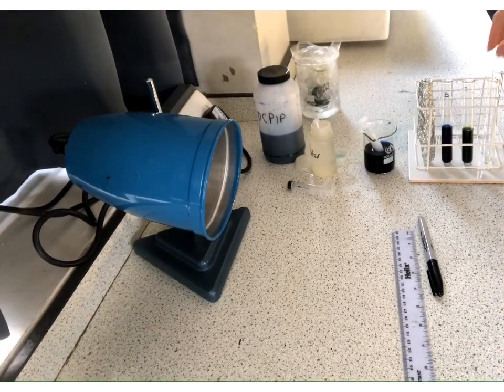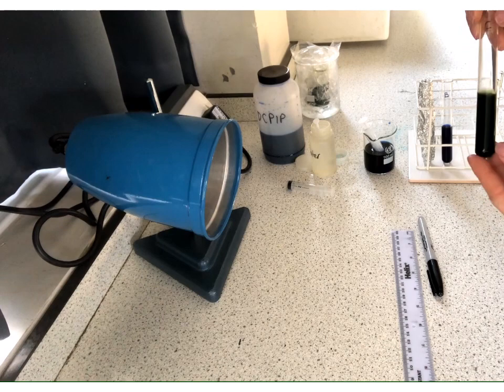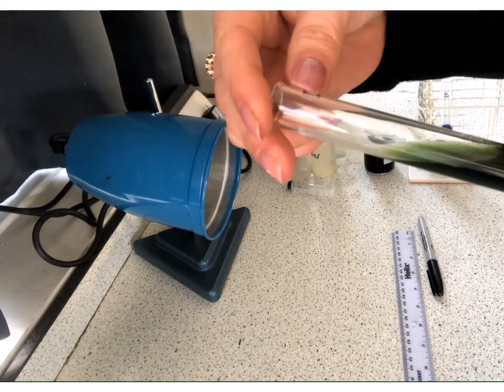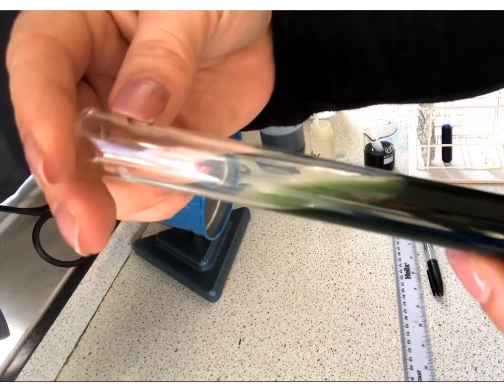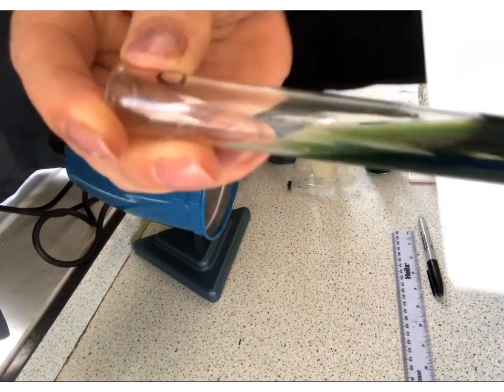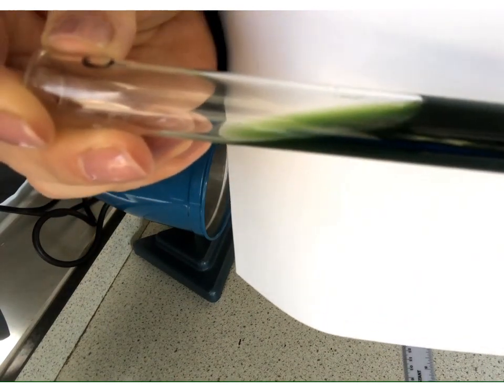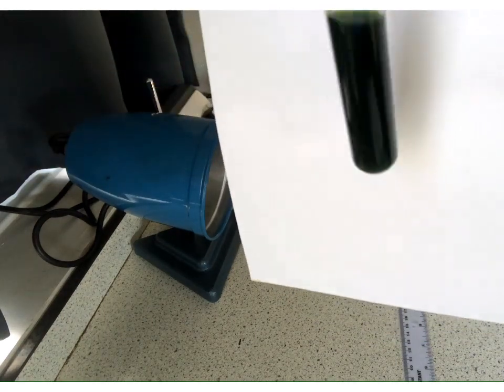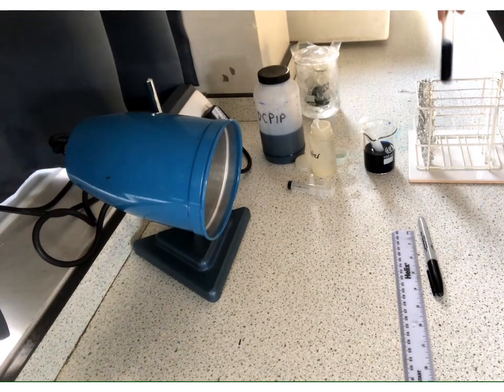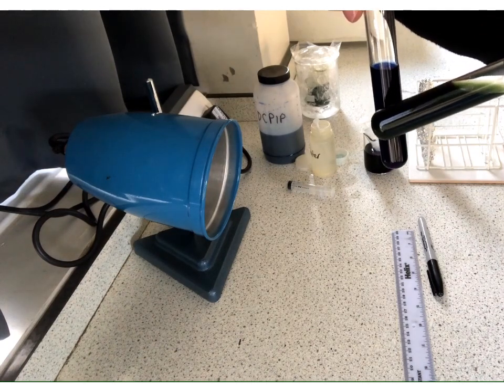Okay, so now we've left tube C for long enough that it has finished. Now hopefully you can see this, but it is very much green now rather than blue. So if you look, there really isn't much hint of blue left. I don't know if this helps at all. Okay, so we know now that that has fully reduced the DCPIP, and that's going to be our comparison now for all the other ones. Okay, if you consider how dark, I know this doesn't have any chloroplast in it, but how dark and rich the blue is, we have definitely lost that blue.